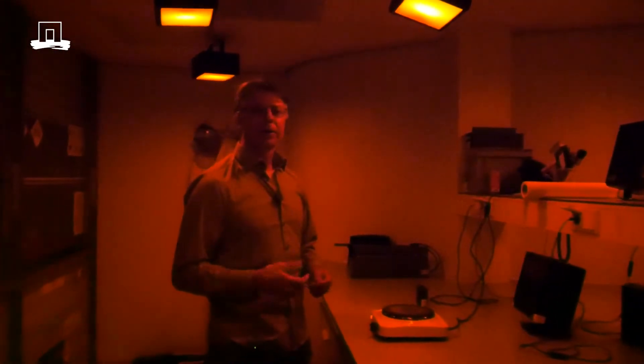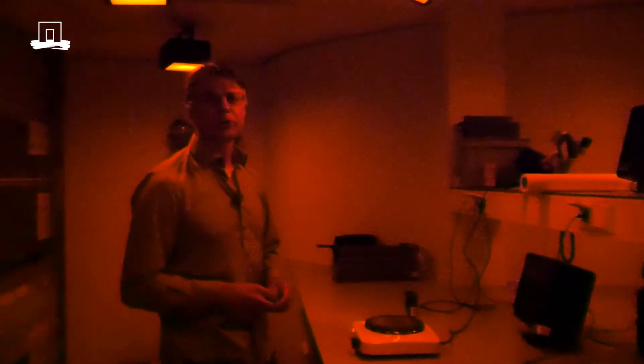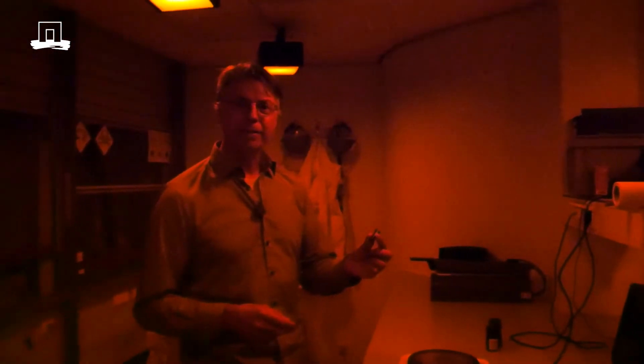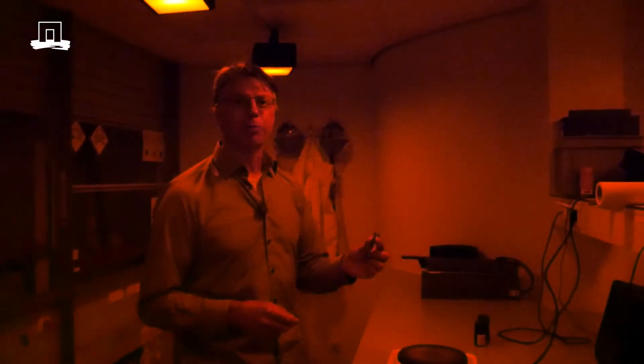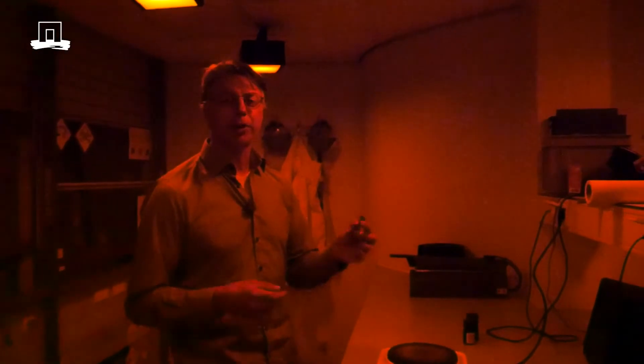The Luminescence signal in sand grains builds up under the influence of natural radioactivity and is bleached — reset — due to sunlight exposure. Now I've got some sand here which thinks it's very old because we irradiated it with a very large dose, and therefore I can show you the Luminescence on this hot plate.